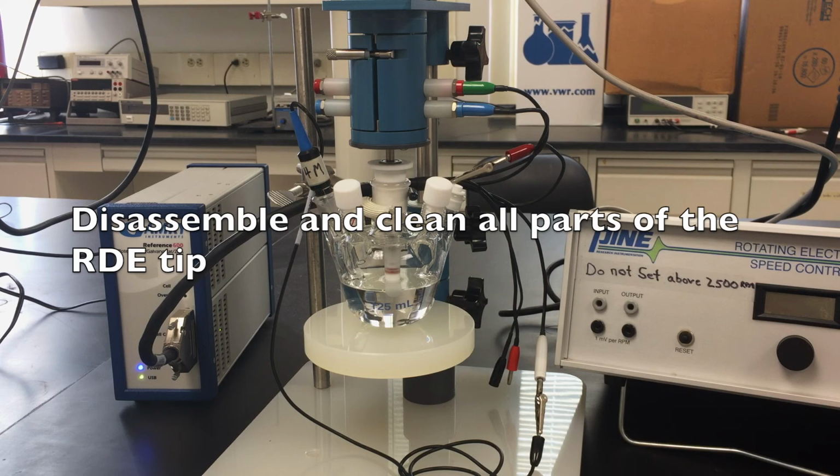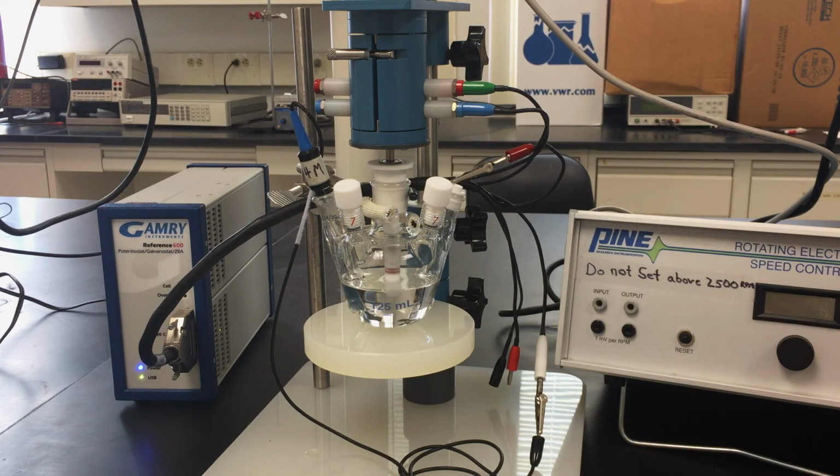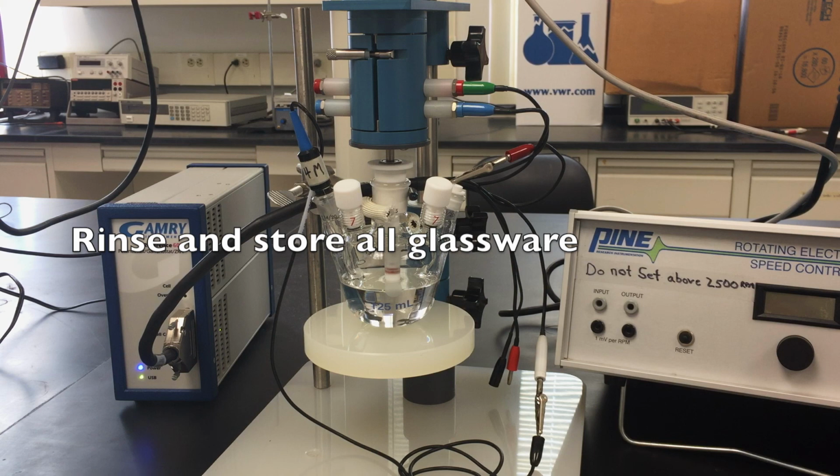For the sample RDE tip, disassemble the tip, remove the sample with the metal rod, and thoroughly rinse all parts prior to returning them to the storage container. Ask the supervising student if the used test solution should be saved for future use or disposed of with the rinsed solution. Before leaving, clean any glassware used and make sure that everything is put back to where it was originally found.